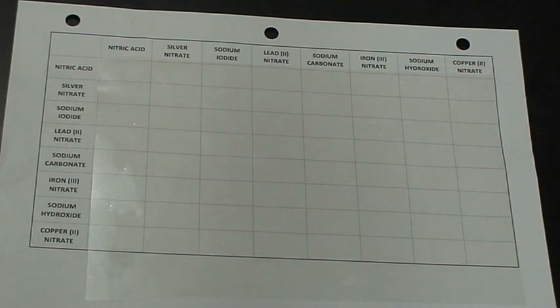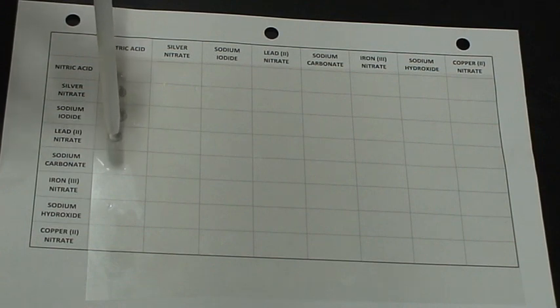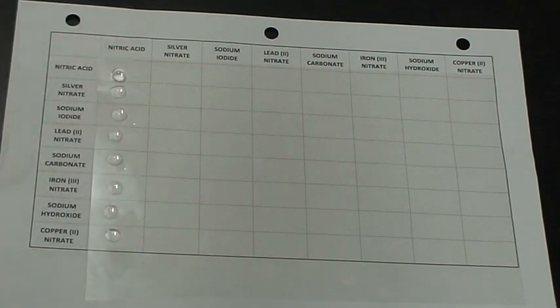So we're going to be taking a look at these 8 solutions here, and I just take a drop on top of an acetate sheet, and you notice the first solution that I'm working with as I go down, we're in the column of nitric acid. So I'm just adding a drop of nitric acid to each of the columns. Now you're going to notice that we're going to mix each of these 8 with each other. So I'm going to now follow the nitric acid across this way as well.